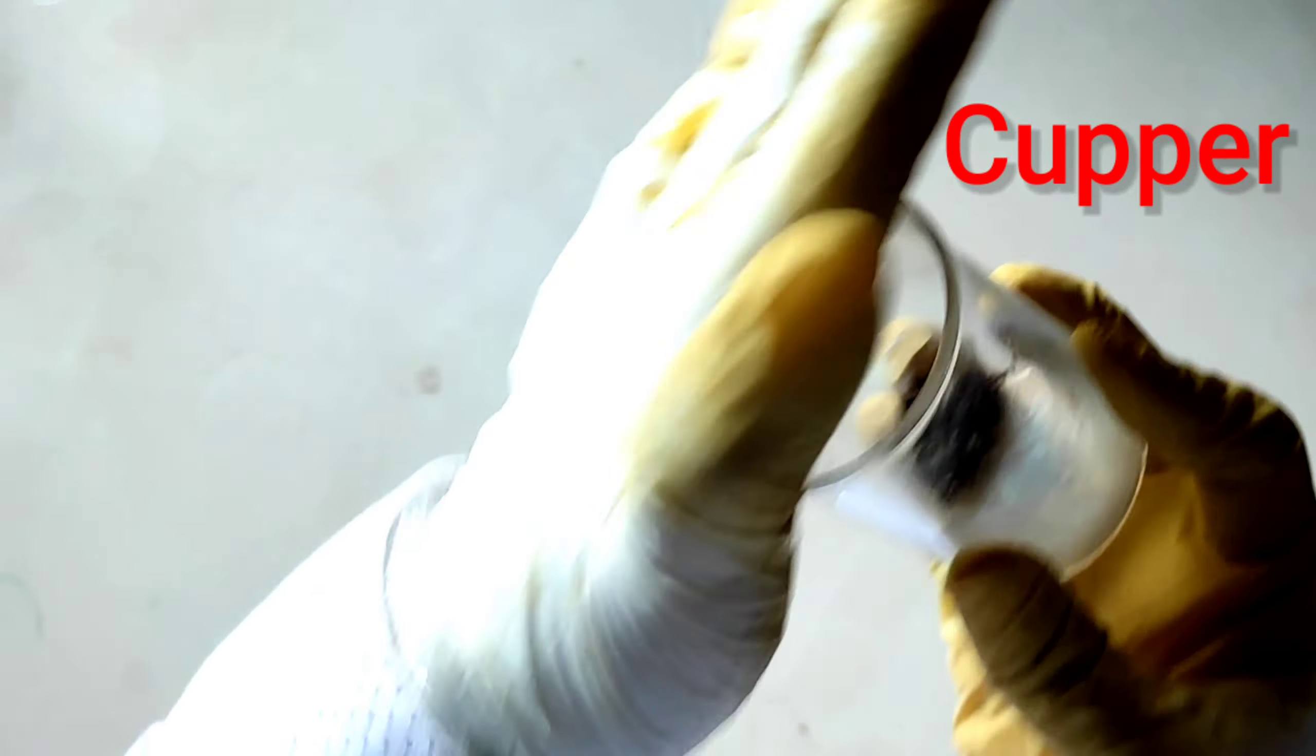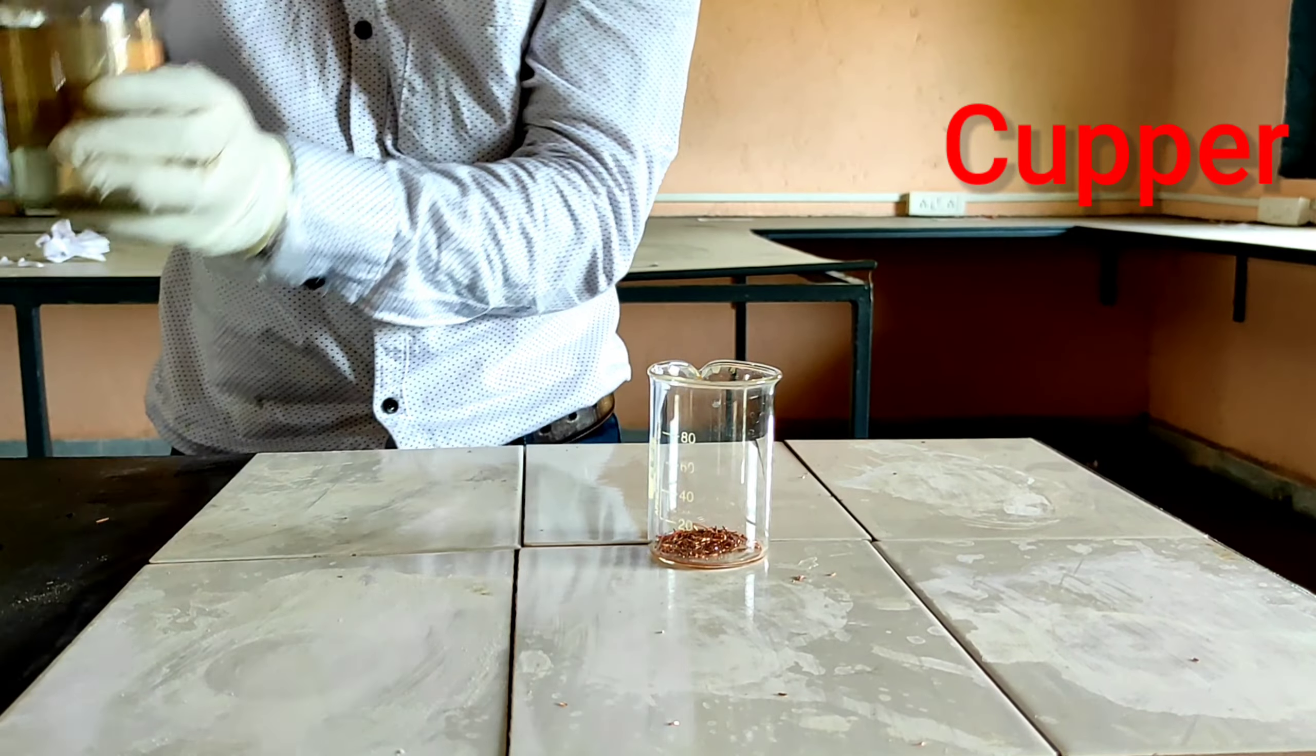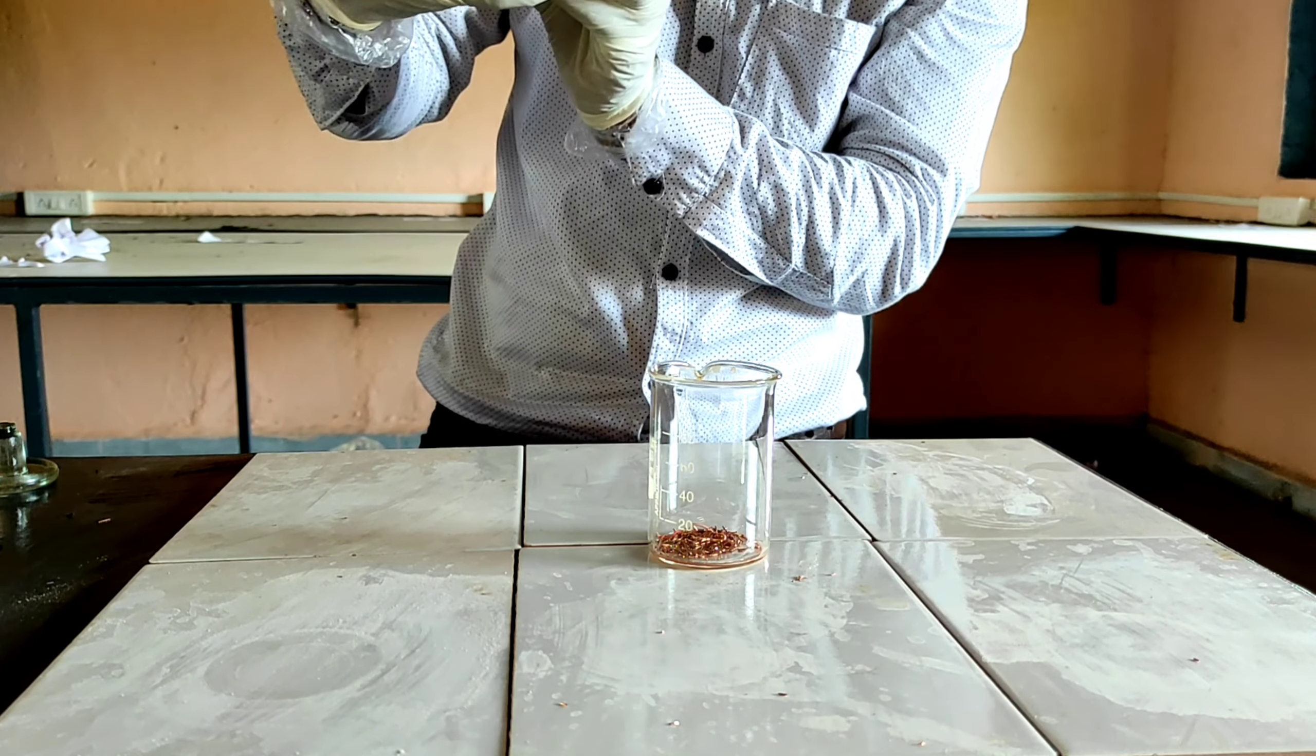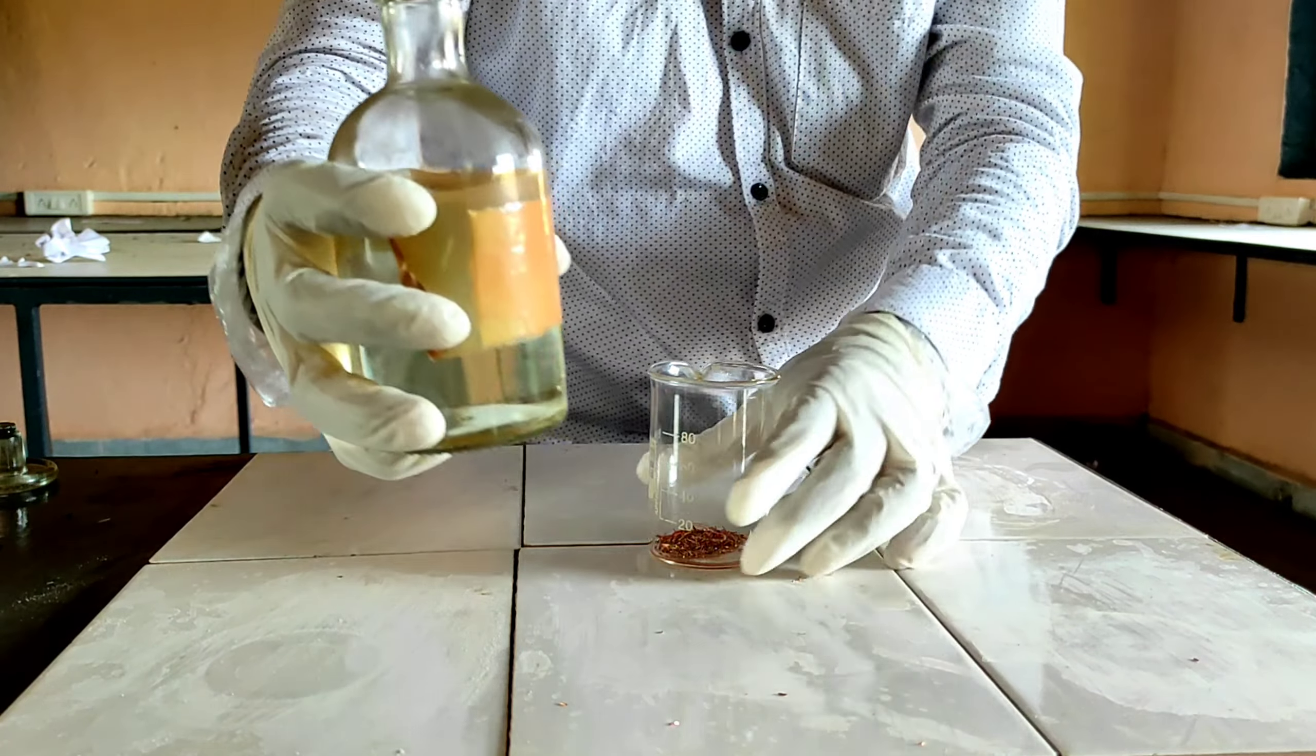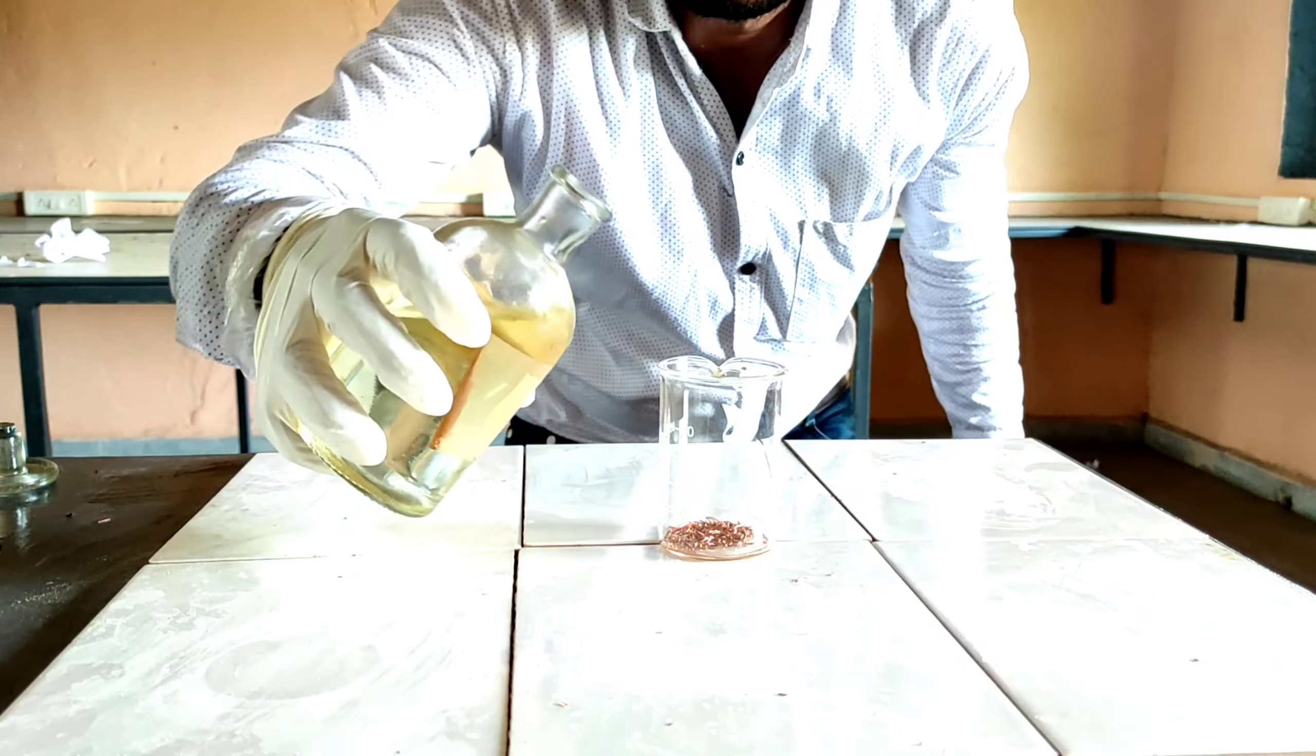In this experiment, we are going to react copper with nitric acid, because hydrochloric acid is basically unreacted with copper.